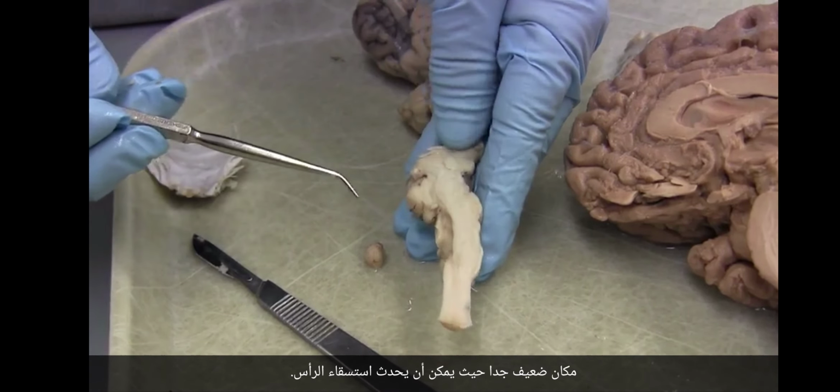Here's the pons. Here's the pons. Here's the midbrain. Here's the midbrain. Here's the diencephalon, and here's the diencephalon right here. And then here's the telencephalon. So the same parts, they're proportionately bigger or smaller, but we've got the same parts.